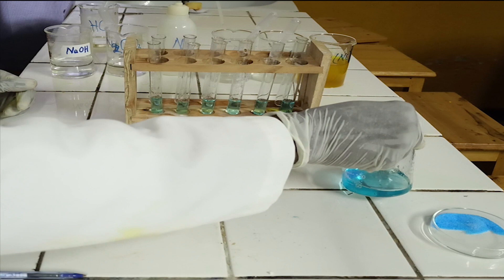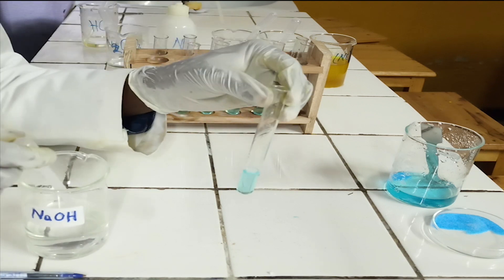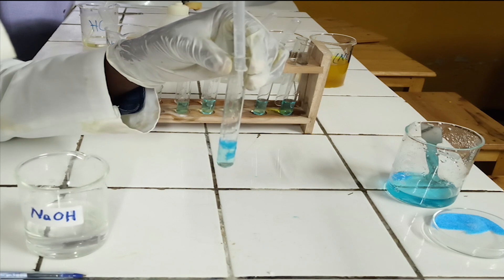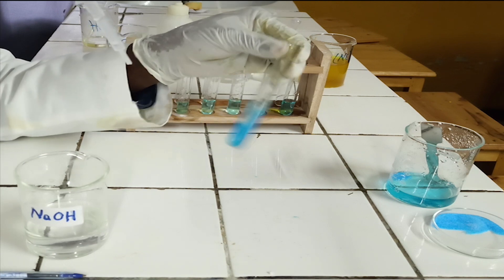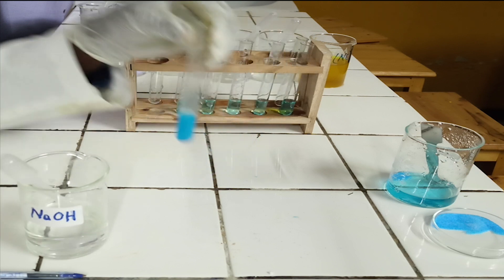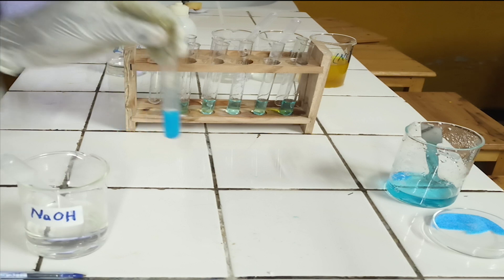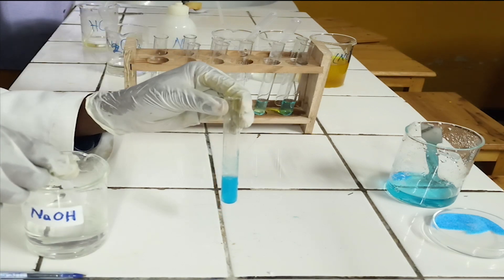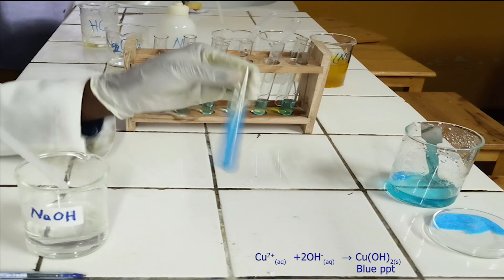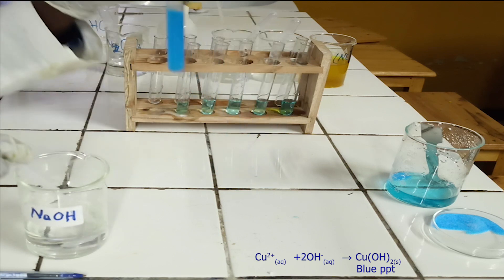Preliminary tests. To the first test tube, add sodium hydroxide solution dropwise until in excess. As you see, sodium hydroxide reacts with copper-2-ion to form a blue precipitate, which is insoluble in excess of sodium hydroxide. Below, there is the ionic equation for this reaction.